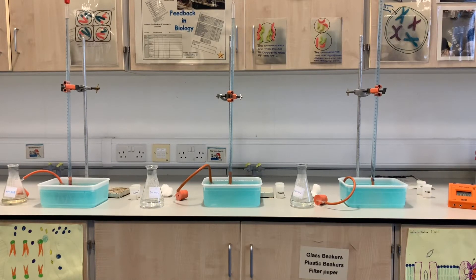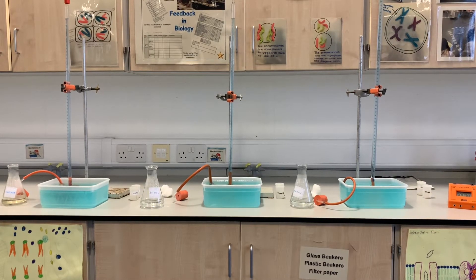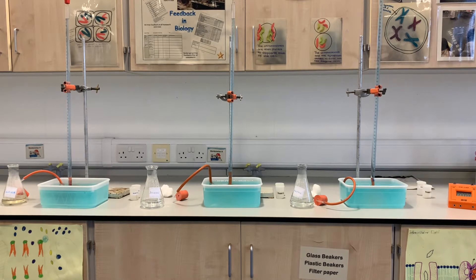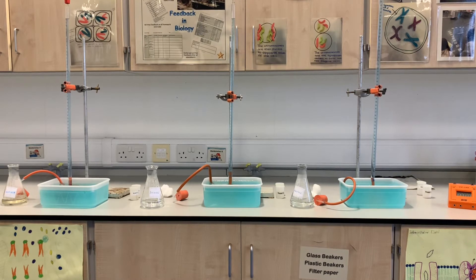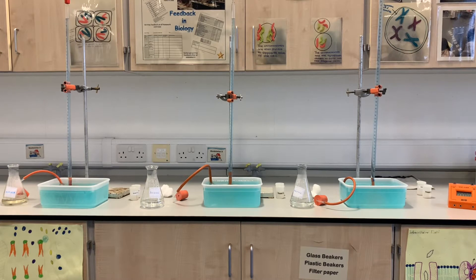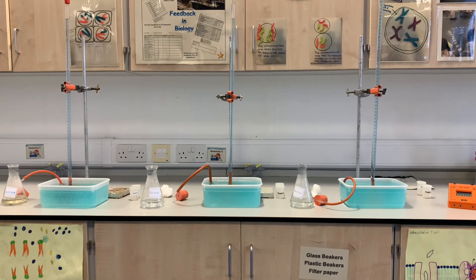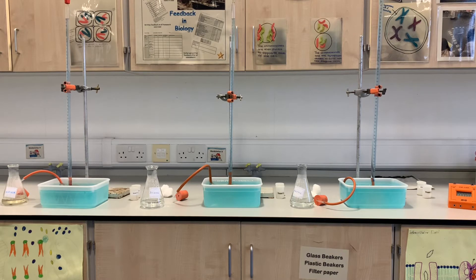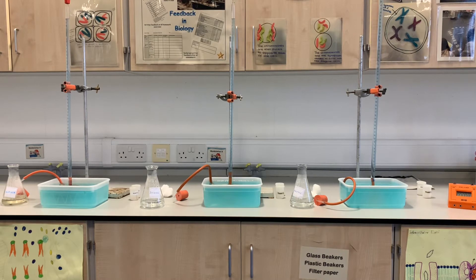In this experiment we're going to investigate the use of three different sugars as respiratory substrates for yeast. We've got glucose, we've got maltose, which is two glucose molecules joined together, and we've got sucrose, which is a molecule of glucose and a molecule of fructose joined together.